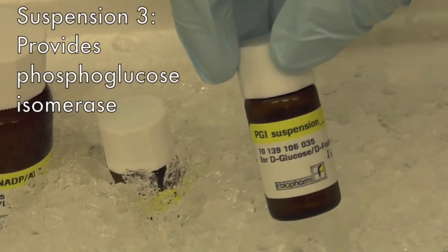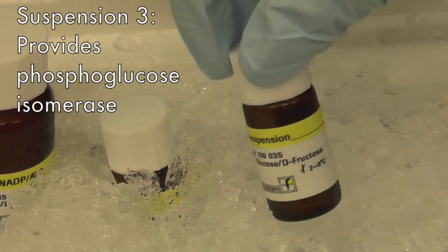suspension 3, which provides phosphoglucose isomerase. All of these have to be kept on ice until use.